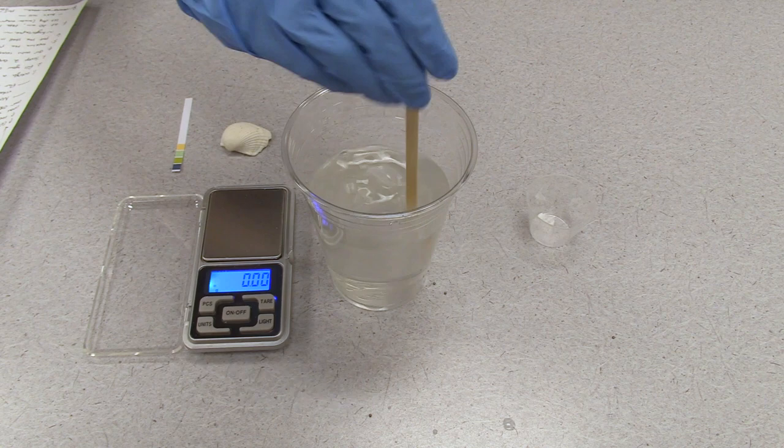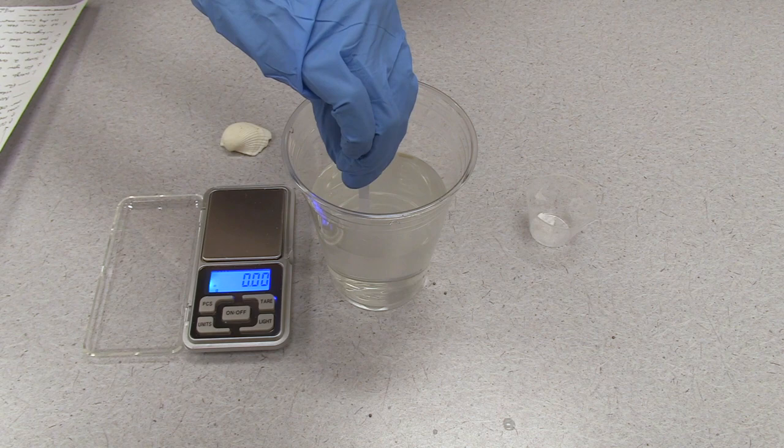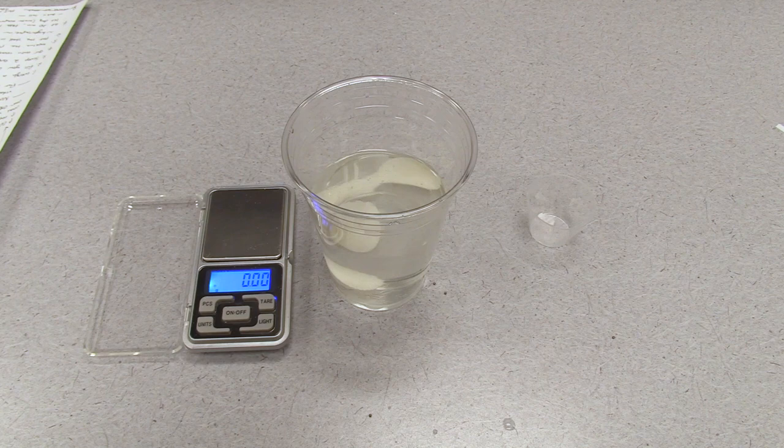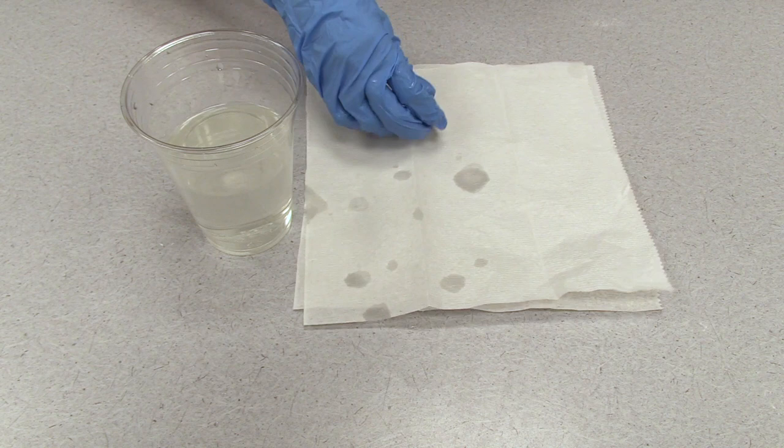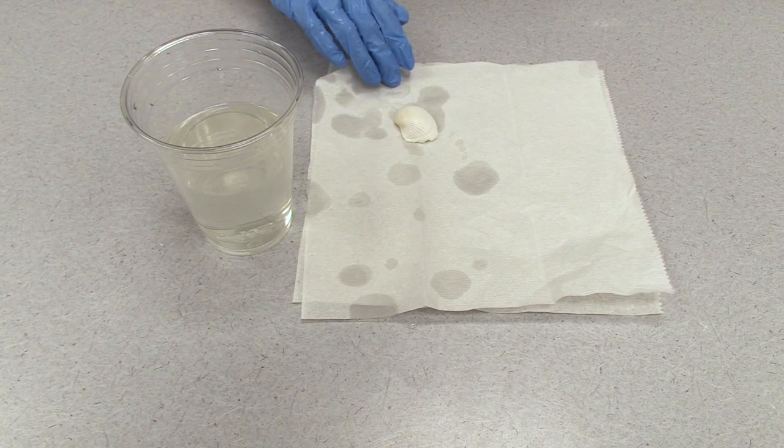After that, you can use your pH strip to measure the pH of the solution. Have a timer ready, and when you're ready, place the shells that you weighed into the low pH solution and record what you observe. After 20 minutes, take out the shells with your gloves on and record the exact time. Let the shells dry for maybe half an hour or so until all the water has evaporated, then measure the weight. Repeat this step two more times so that you have data points of the mass of the shell at 0, 20, and 40 minutes.